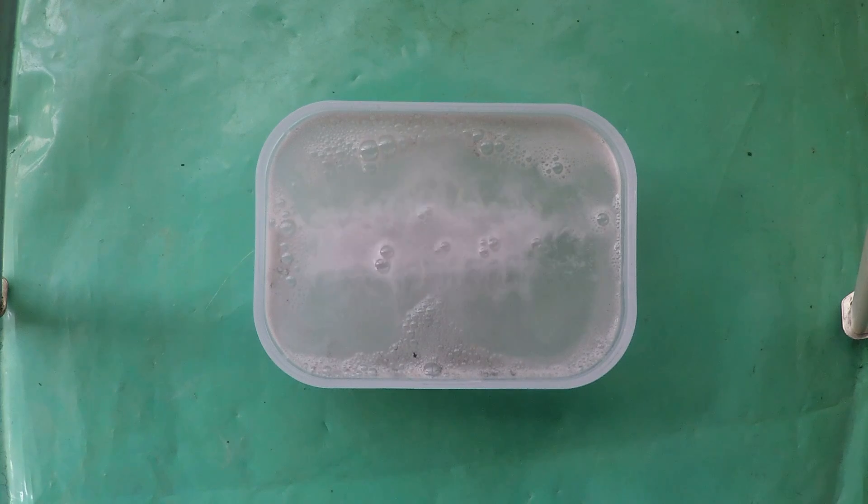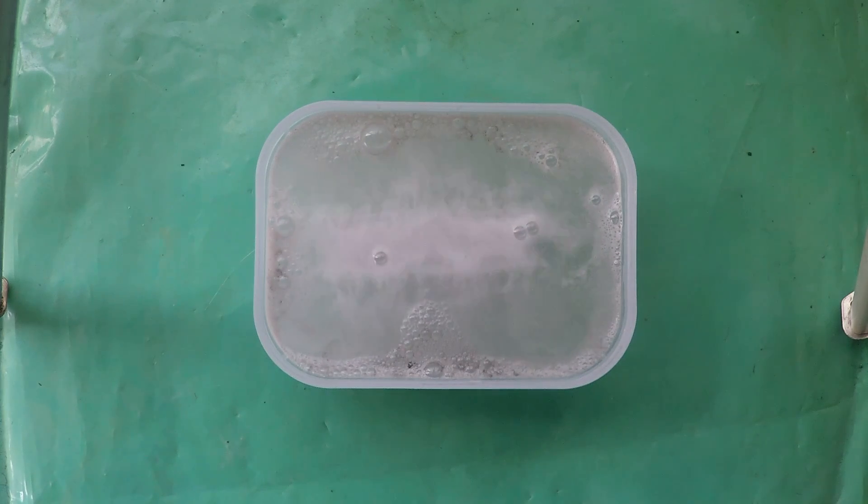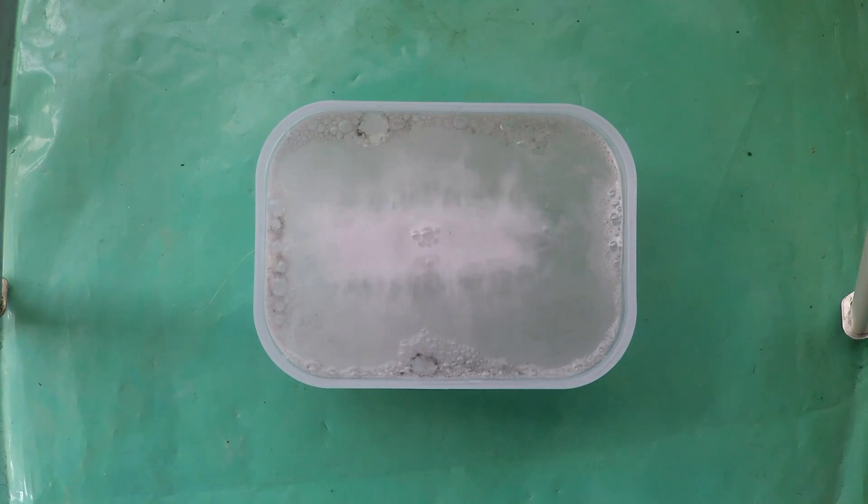Put the lid back on the caustic while we're waiting. Okay. Now afterwards when you finish with this if you don't want to throw the caustic out store it in a plastic container not glass because it will attack the glass and make certain the container's got an airtight lid on it.